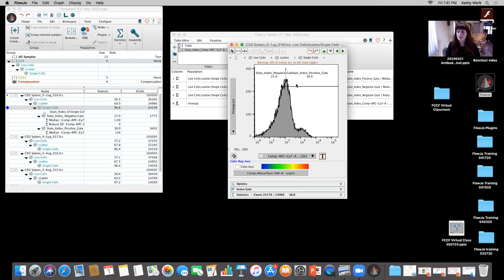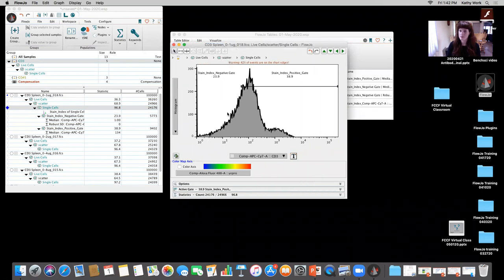Now, it automatically did not do the best job. Sorry about that. I unplugged the phone before this, but I think the power is low. So the positive gate and the negative gate are off, right? So it did it the best it could, and sometimes it's usually pretty good, but this is off. So I'm going to take this positive gate right here, I'm going to drag it up, and then here, the negative is actually kind of down towards the axis, okay?